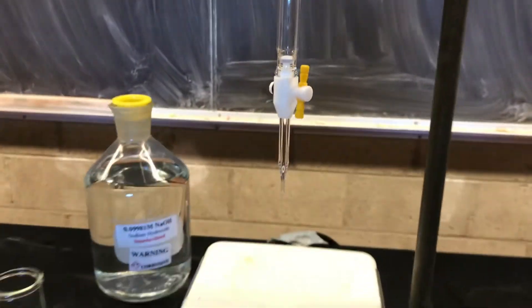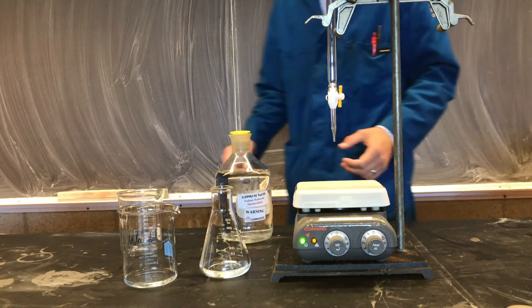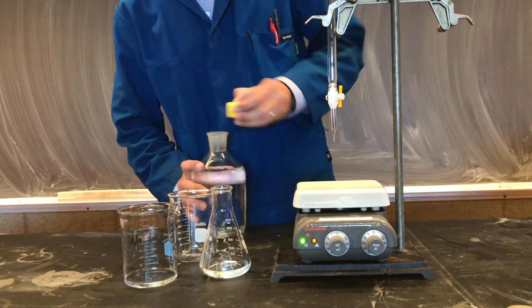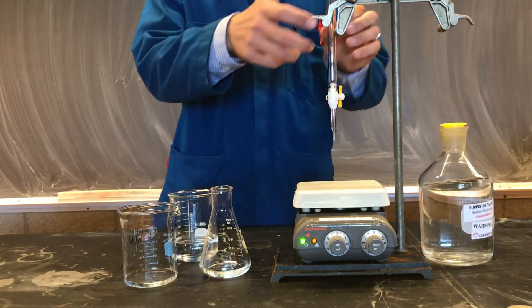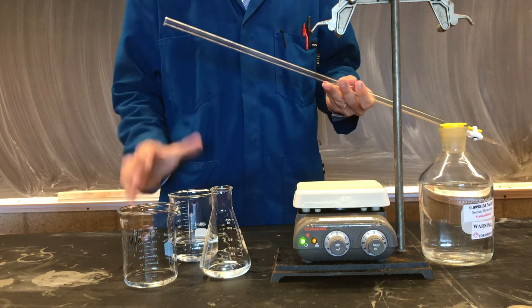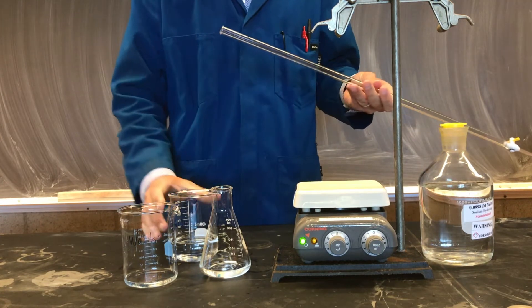To prepare for our titration, we'll take our burette and attach it to a stand using a burette clamp, and beneath that we'll place a hot plate which we'll use for stirring. The first step in a titration is to condition our burette as we did before with our volumetric pipettes. We'll take a small amount of our titrant, which today is 0.09981 molar sodium hydroxide.